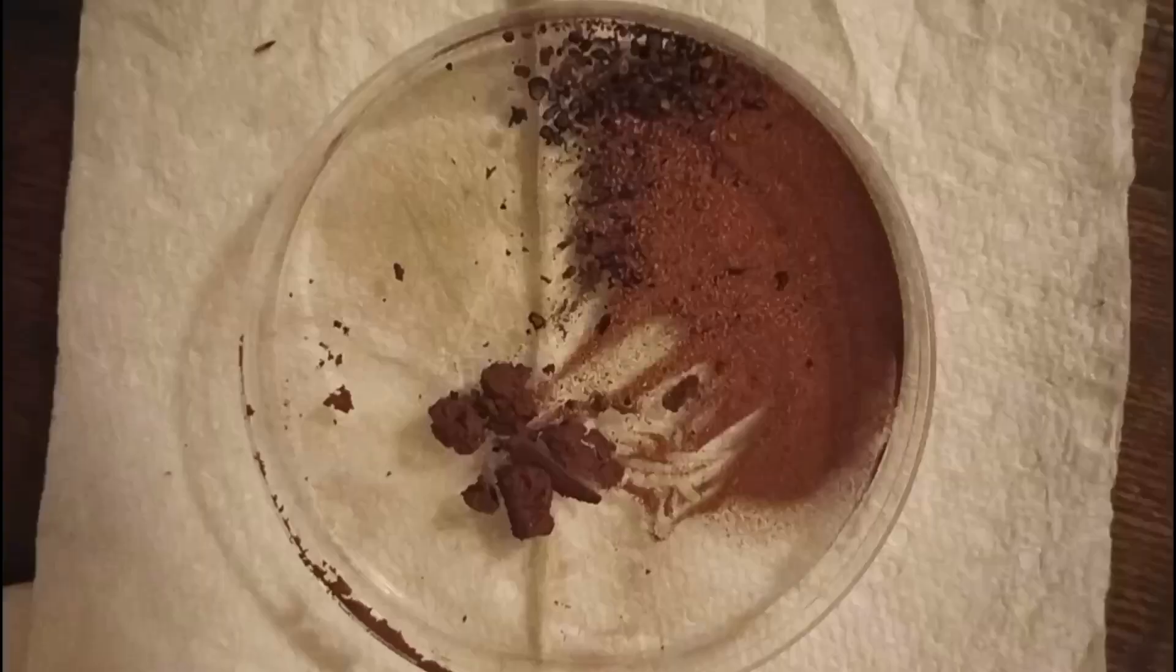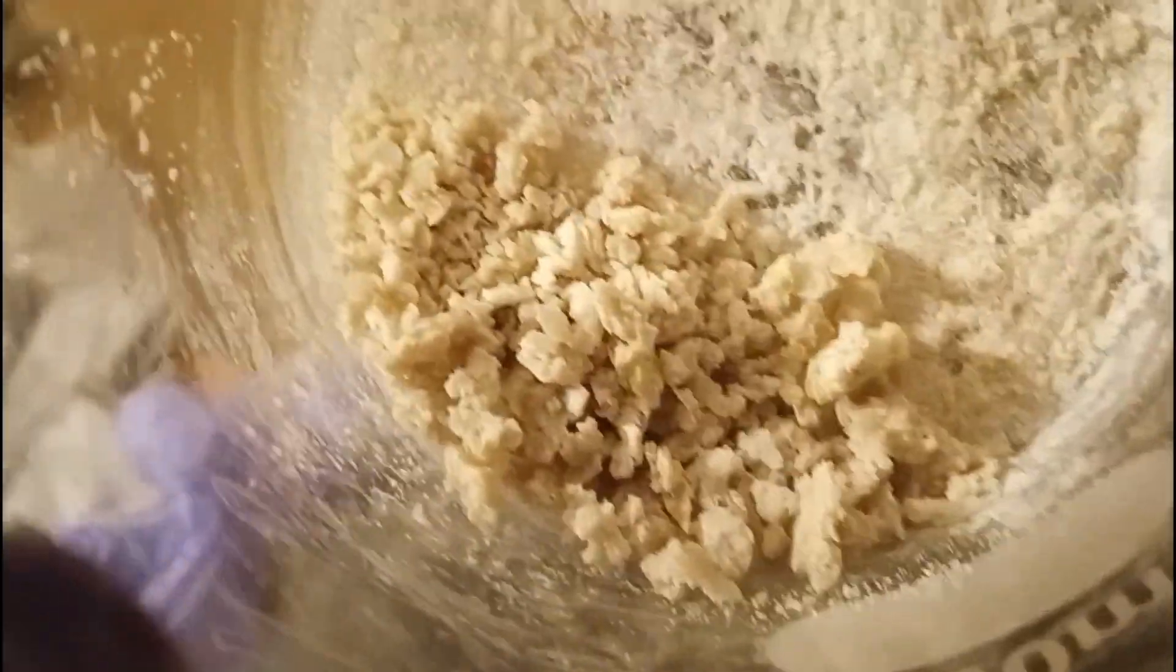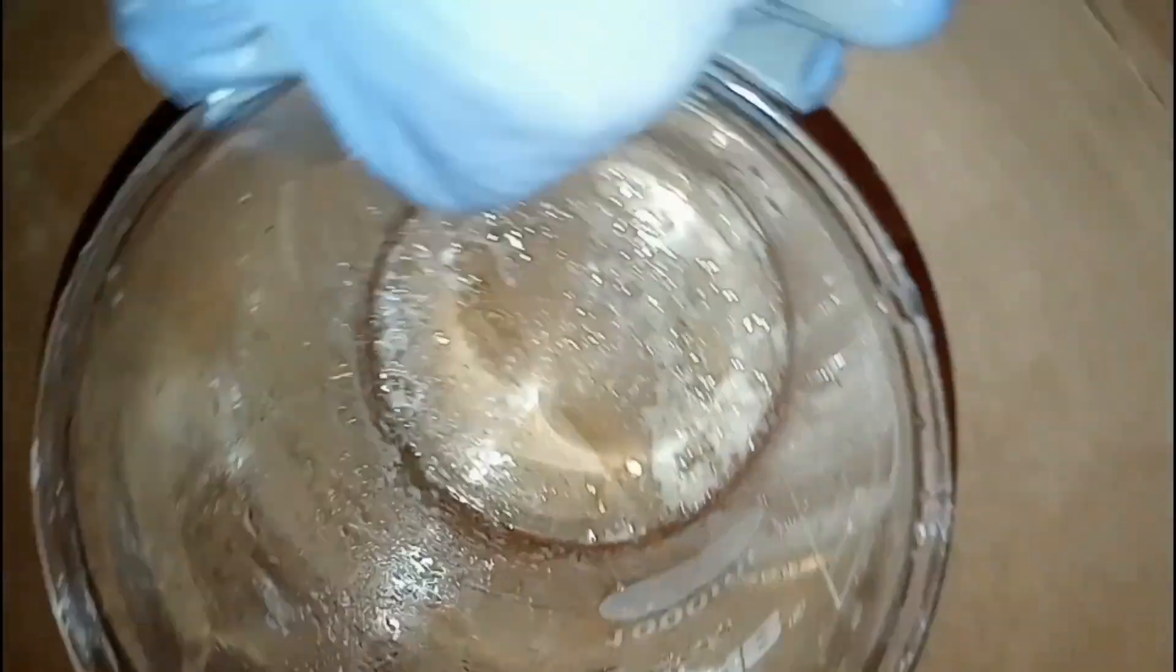So I took the copper substance and put it in a petri dish with the other. You can see the new stuff wasn't completely dry, so it's in little balls next to the powdery stuff that we had before. So breaking up what we had in the beaker here, it does kind of look like rock candy. It sure left the beaker a mess, but fortunately, zinc acetate is supposed to be water-soluble, so it should be an easy cleanup.